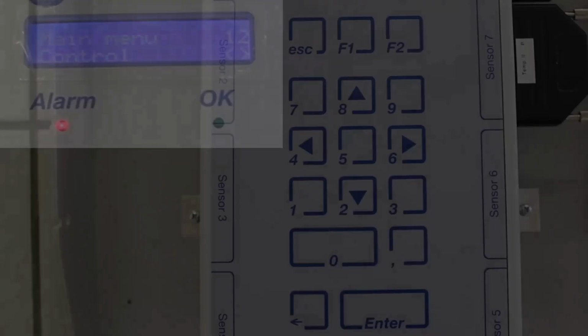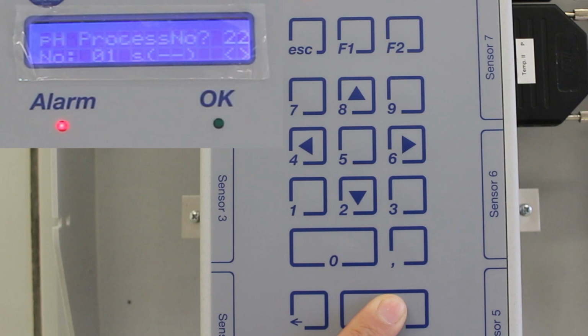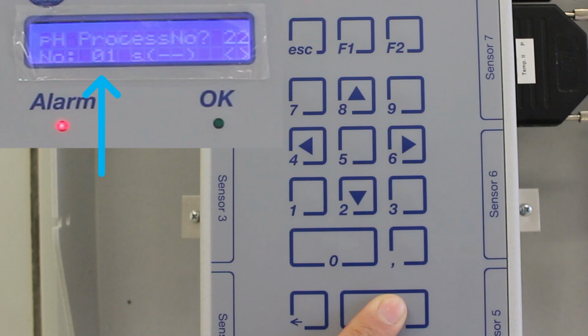In the main menu level, select the menu Control. Now, select pH value. If you have connected several pH modules, you can press the arrow keys to select the desired module. Don't forget to make notes. Once a module is selected, you can allocate several control functions for one module. The number of processes is indicated on the lower line, and the socket for controlling is indicated inside the parenthesis. If there are 2 dashed lines inside the parenthesis, the control process is not yet allocated to any socket.